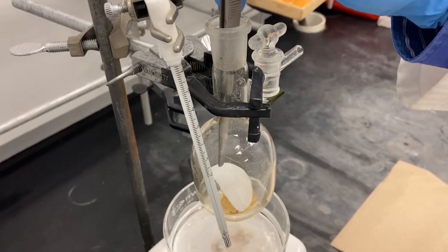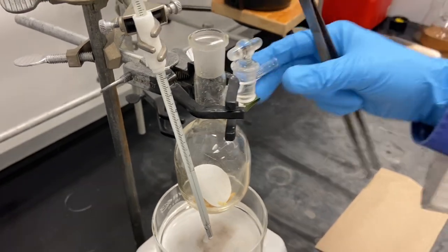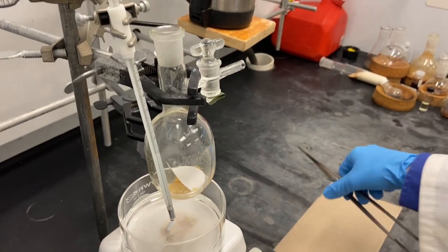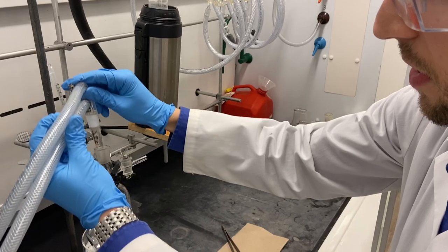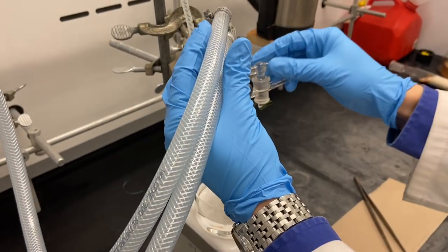Ideally this just sits on top of the whole thing, a little bit wound on top but it should be okay. It should just in general cover the area that faces the sublimation cooling thing.